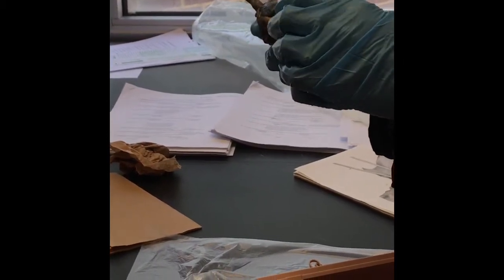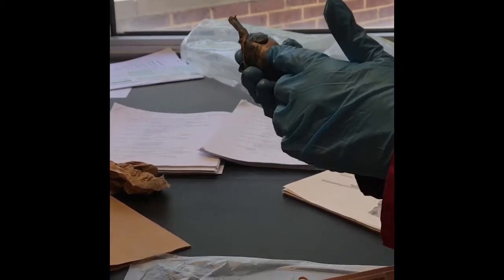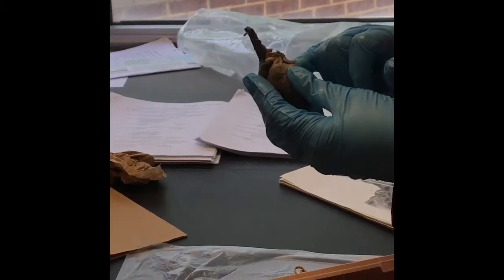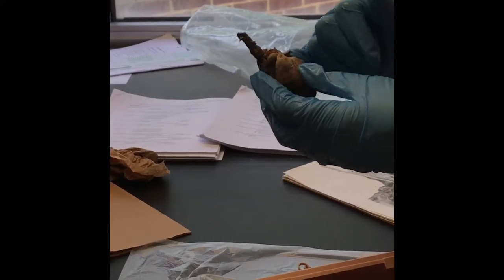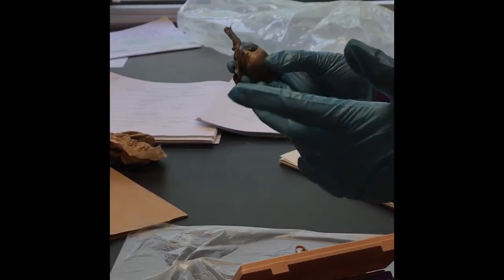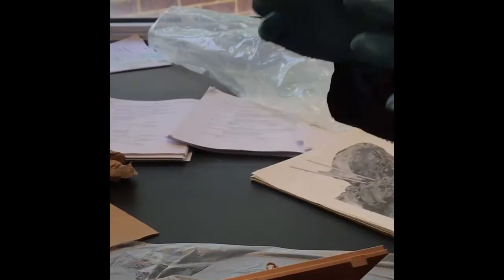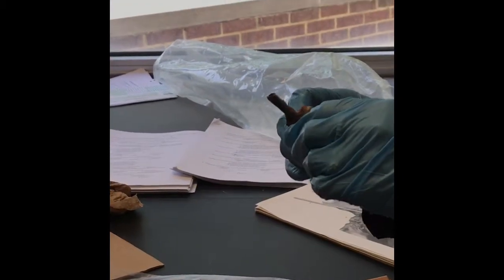First off, the chambers. Right atria, much larger than the left atria. It's collecting all deoxygenated blood from the body. Okay? Right ventricle over here. Do you really see this division until you open up? No, but if I have a pin over here, it's on the right ventricle. Left atria, very small compared to the right atria. Okay? Left ventricle. Questions I'll ask. What side of the heart is carrying oxygenated blood? Left side. Which side of the heart is carrying deoxygenated blood? Right side. Okay, those are the kind of questions I'll ask.